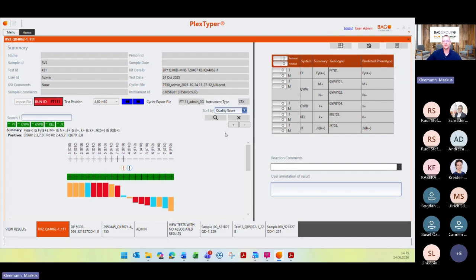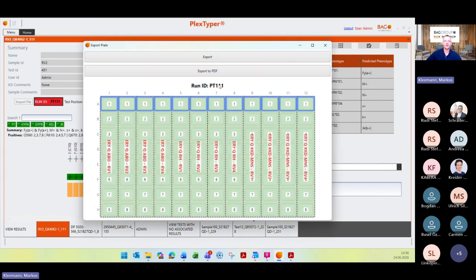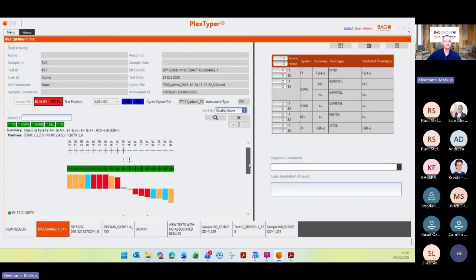Then you can export the data with different options. You can export the data as a text file, as an NHSBT file, or as an HTML file if you want to. Especially for the HLA users, maybe this is interesting. And maybe one last thing: you can also print this plate layout again or send this layout if you have any problems with your runs and we need this information about the plate layout. Then you can export these files as a PDF table and save this on your computer.